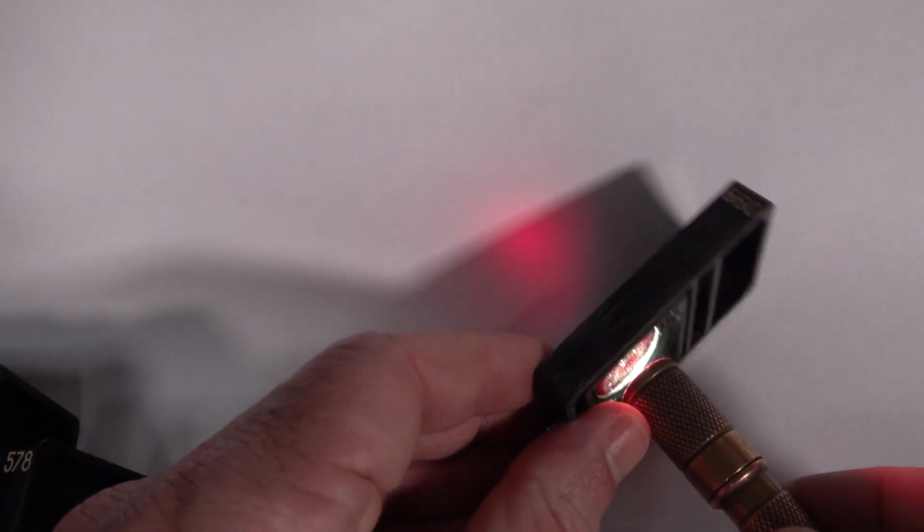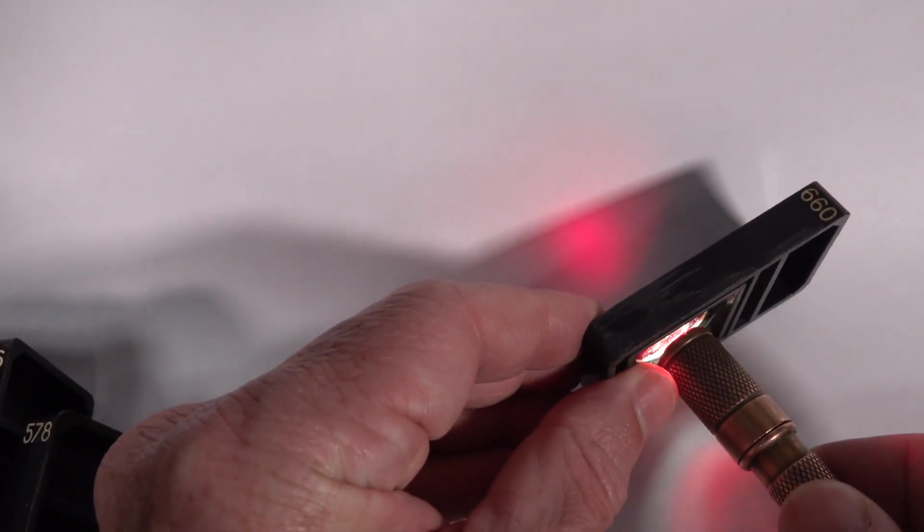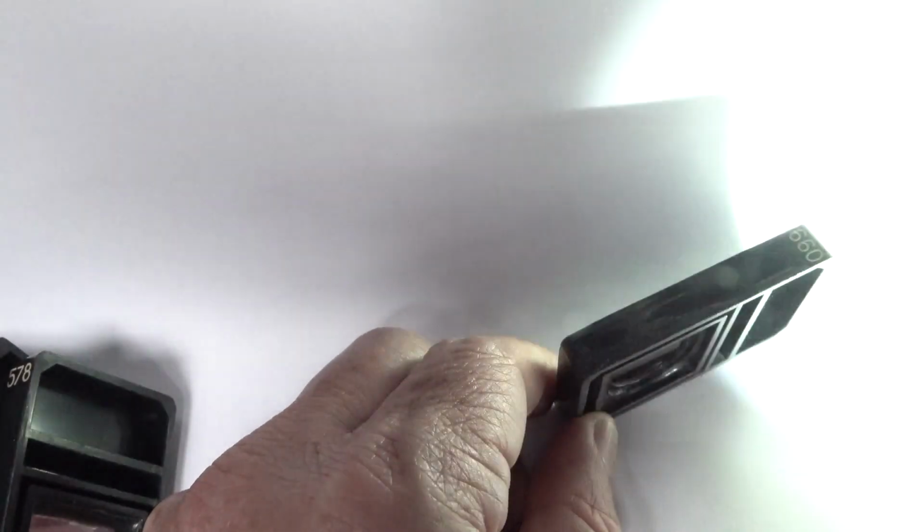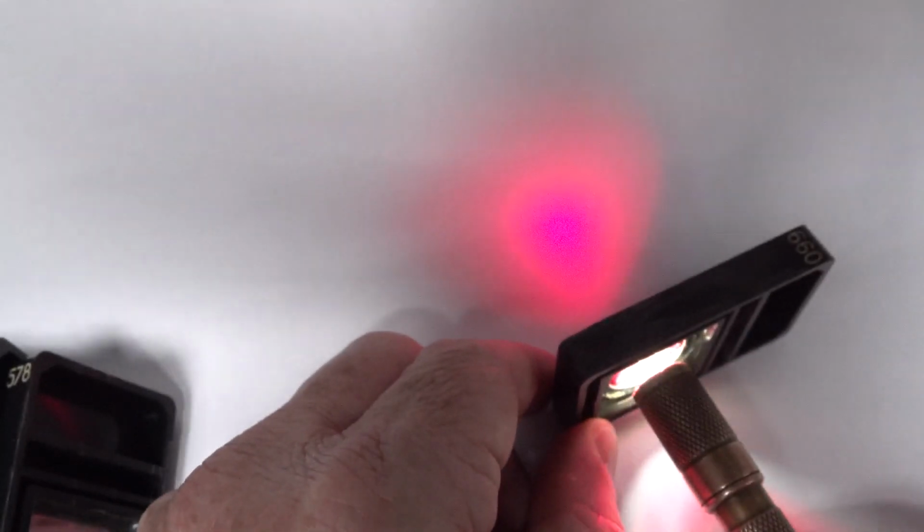660. Oh, so that wasn't the highest. Here we go, 660. That one's actually got more attenuation than the other one, doesn't it? That's interesting. Let me turn off these studio lights here. This might actually work better. Yeah, that's better. So that's 660 nanometers. I'll fix the exposure. I've programmed one of my buttons for exposure. Okay, we've got fixed exposure on the camera, so it shouldn't change now. That's our 660 nanometers.